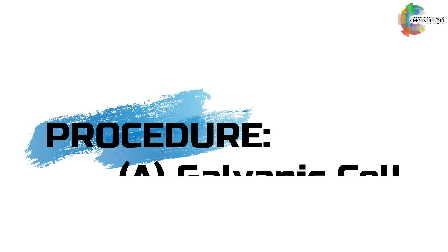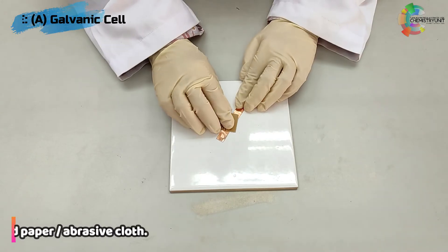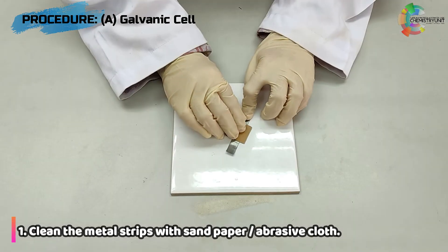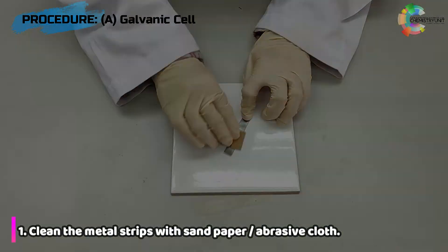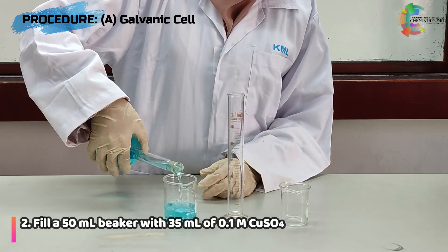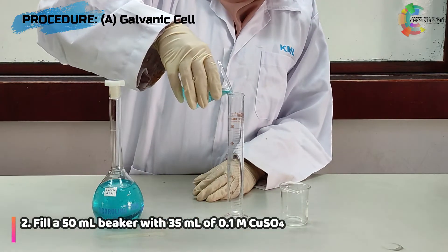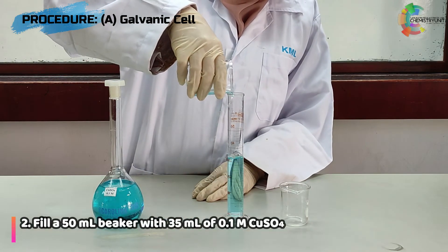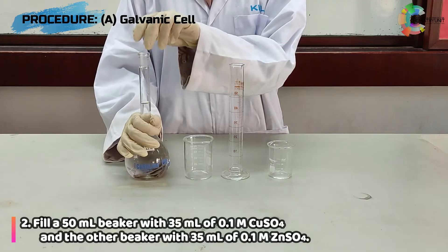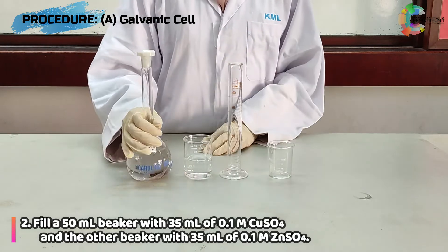Now let's have a look at the procedure for Part A: Galvanic Cell. You will start by cleaning the metal strips with sandpaper or abrasive cloth. Next, in step 2, fill a 50 ml beaker with 35 ml of 0.1 molar copper sulfate solution, and the other beaker with 35 ml of 0.1 molar zinc sulfate solution.